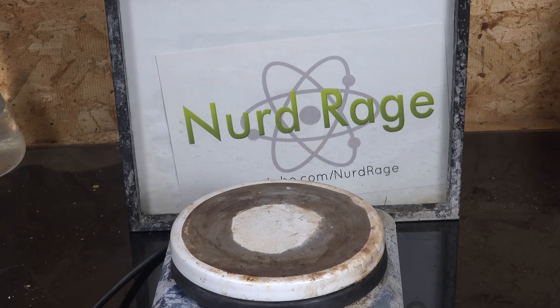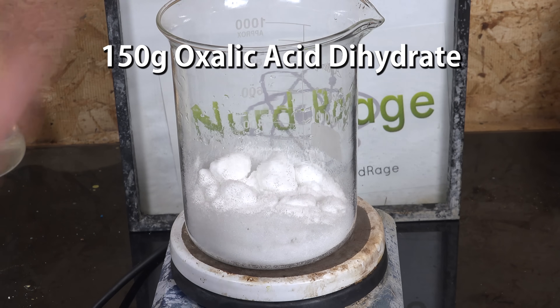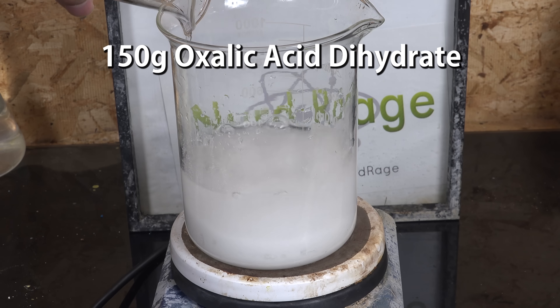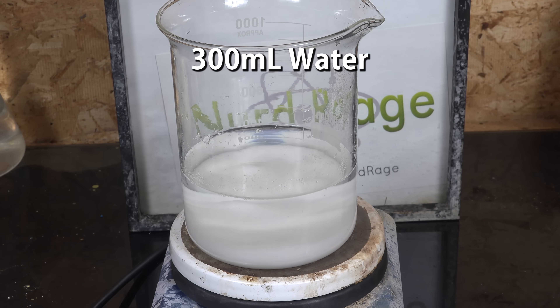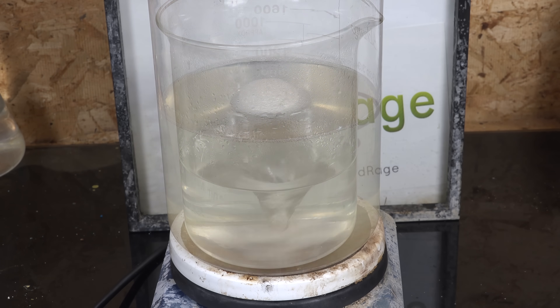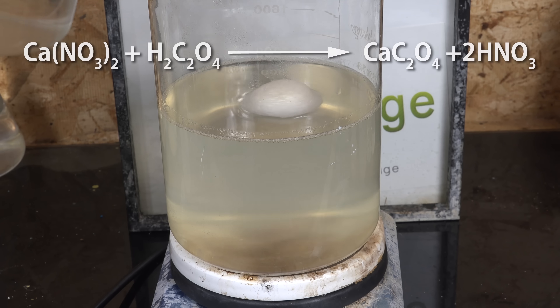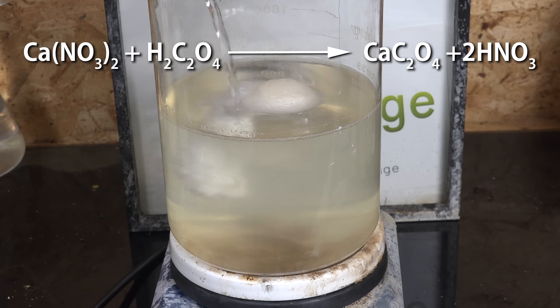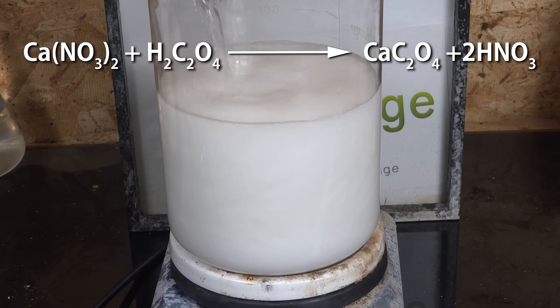Anyway, while that's dissolving, we get 150g of oxalic acid dihydrate and to that we add 300mL of water. Then we heat that up to dissolve. Once it's all in solution, add directly to the calcium nitrate solution. What's happening is the calcium nitrate is reacting with the oxalic acid to form highly insoluble calcium oxalate.